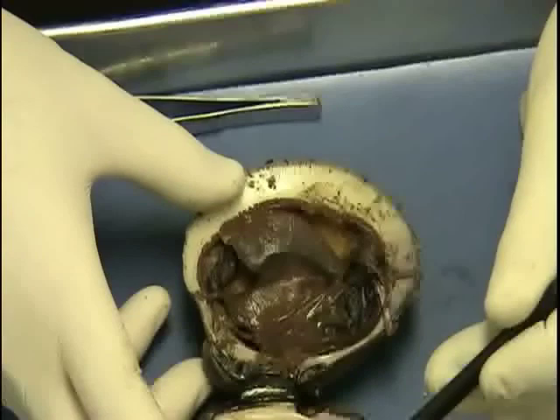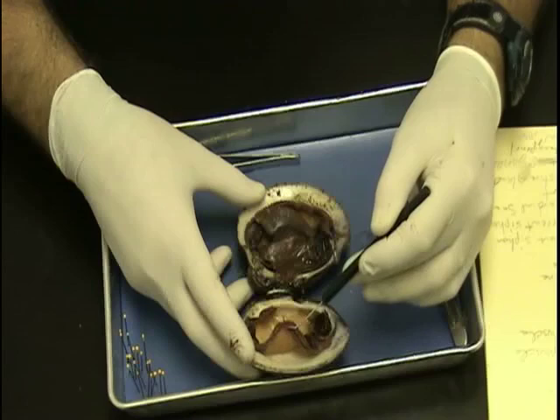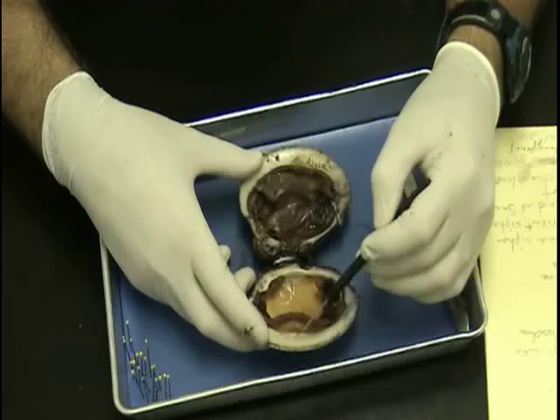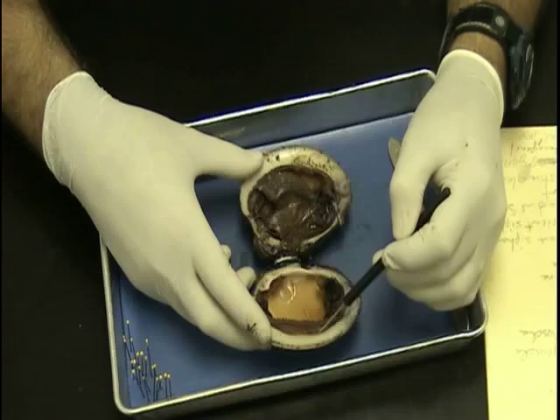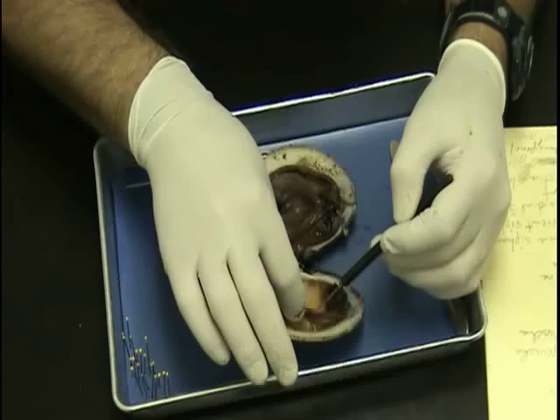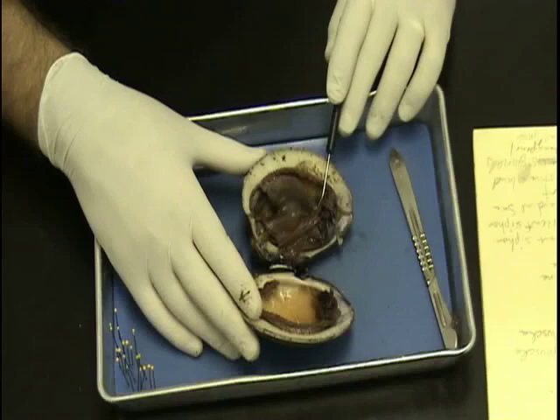The mantle is this right here that lines the valve. The mantle actually is what makes the mother of pearl — the mother of pearl is the light color that lines the valve. When a clam makes a pearl, it's because you get a little piece of sand or grit in that valve. It causes a little irritation to the clam, but it secretes mother of pearl around that sand grain and forms a pearl. With cultured pearls, what they'll do is pull the mantle back, put a little plastic bead in there, and the mother of pearl will be built around the plastic bead — that's how they make cultured pearls.